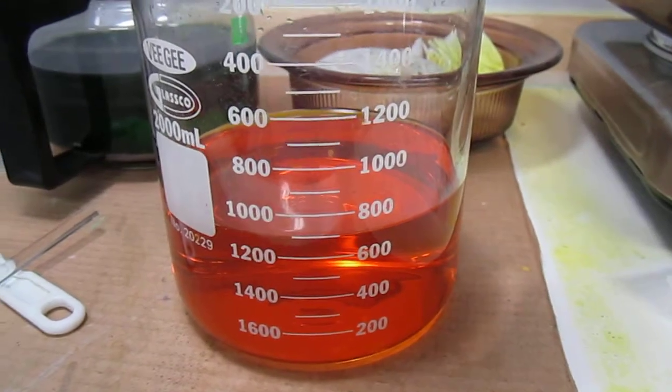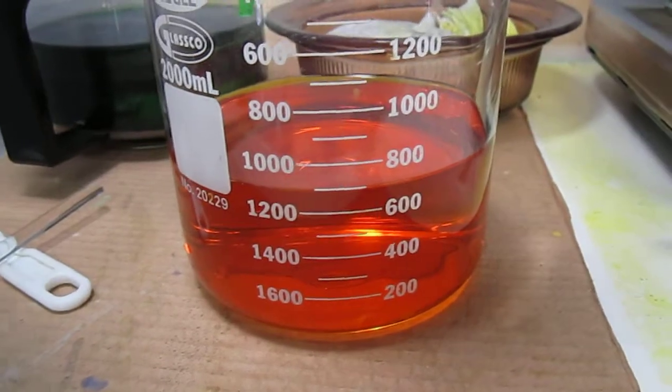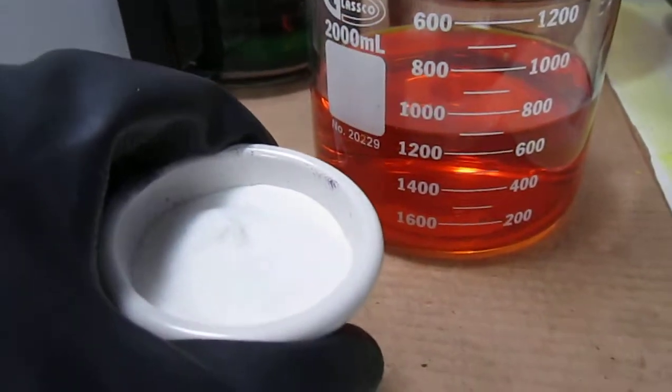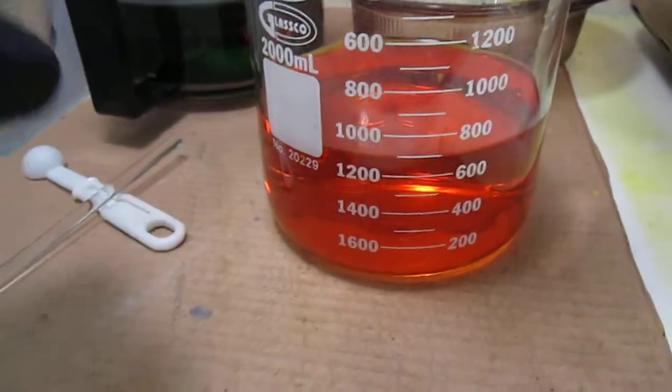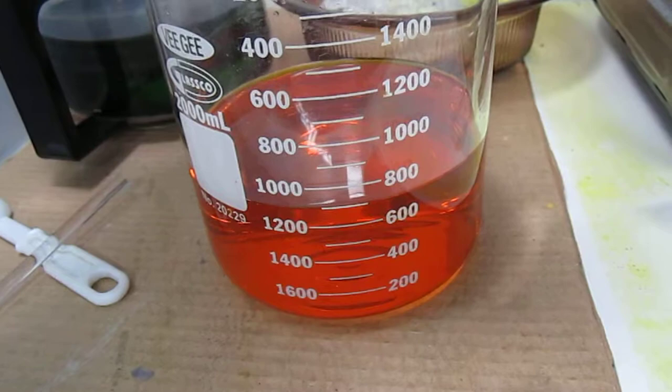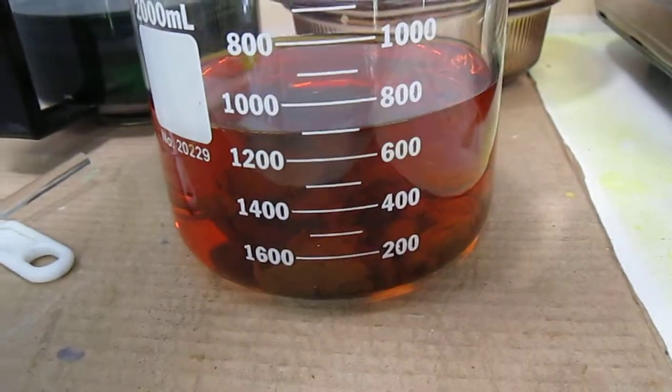Well, the time has come to precipitate the gold out of our solution. I have 61 grams of sodium metabisulfite that I will start adding and there is an immediate reaction.